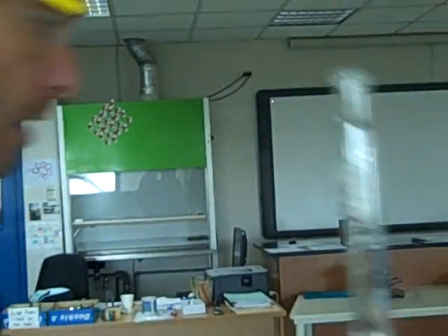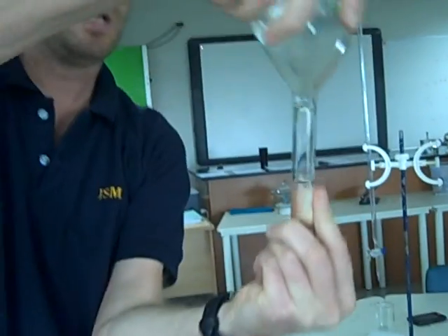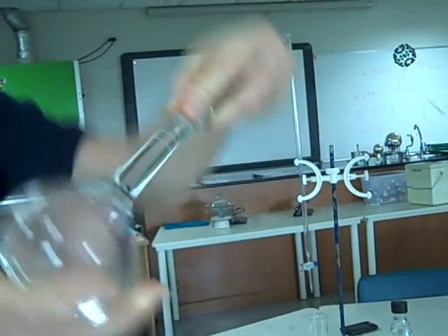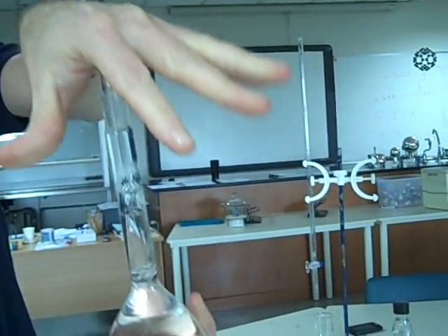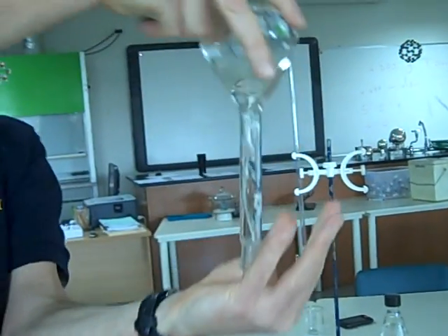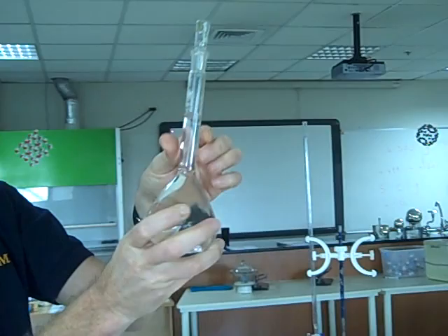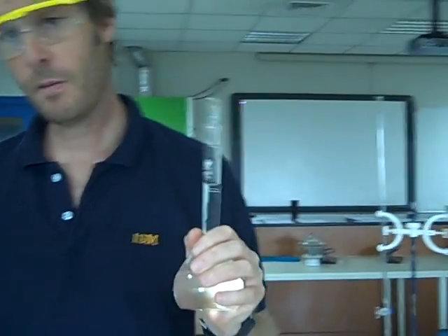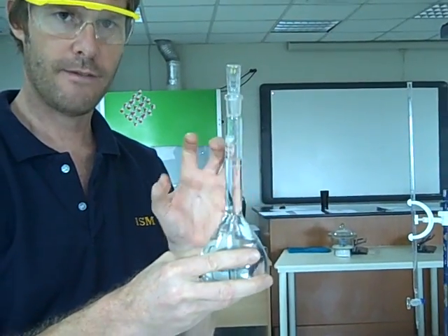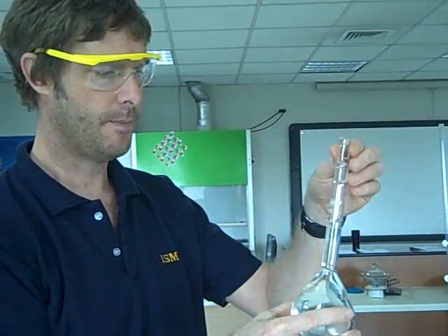I'm not going to start again. If you do it, you will need to. We then put our ground glass stopper in. And to ensure proper mixing, we turn it over. A good four or five times, so we get a nice homogenous solution. Now then, if I've done that correctly, and if my meniscus is on the bottom of my line, I have 250.0 cc's of my solution with a precisely determined mass of oxalic acid in it. That means I can find the concentration of this solution accurately later on. This is my solution of the acid.